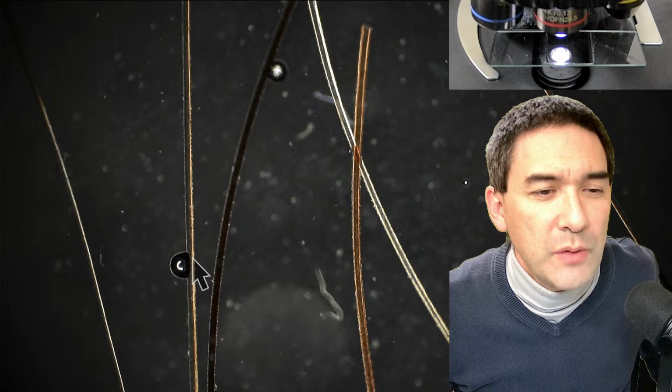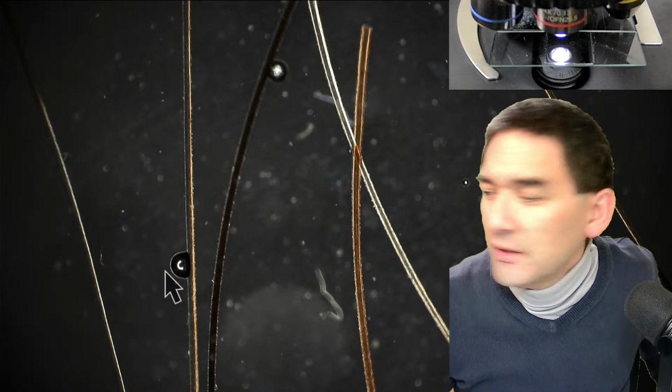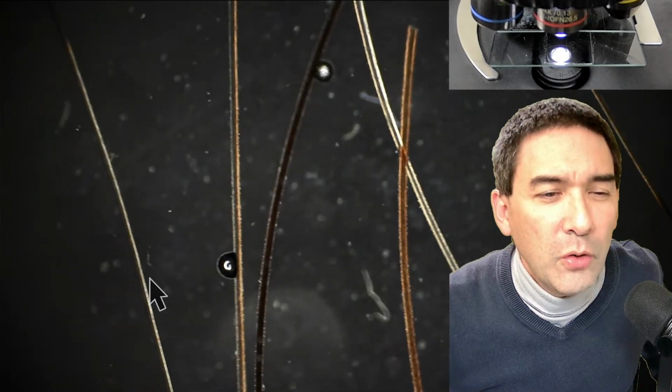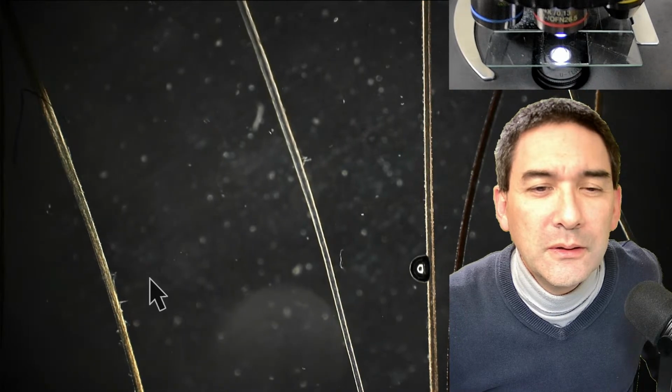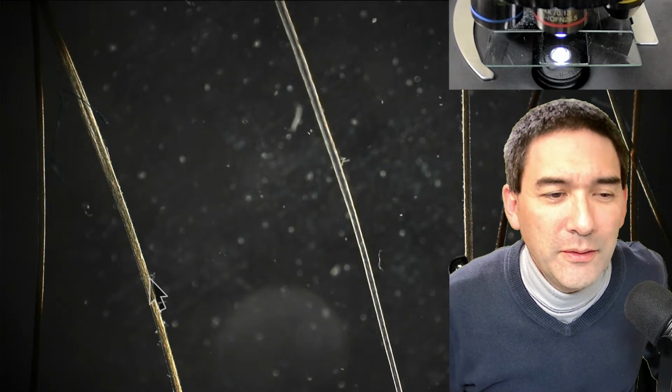Look, this is actually quite interesting. I'm just noticing this right now. Do you actually see that here the right side is brighter than the left side of the hair? What I'm going to try now is to move the hair over to the other side. Look at this. Isn't this cool? Now you have to check a little bit. You see? And the hair now, follow this here.